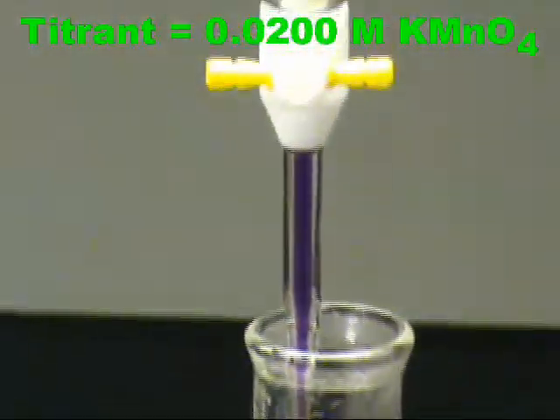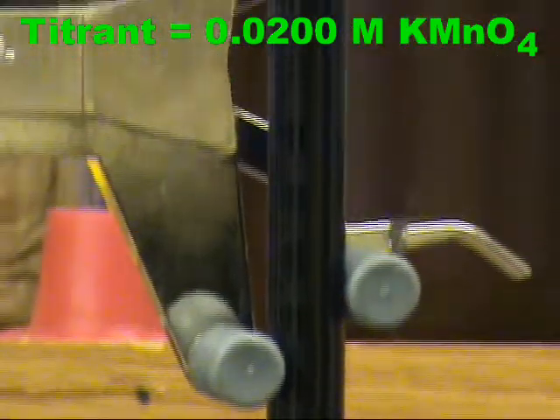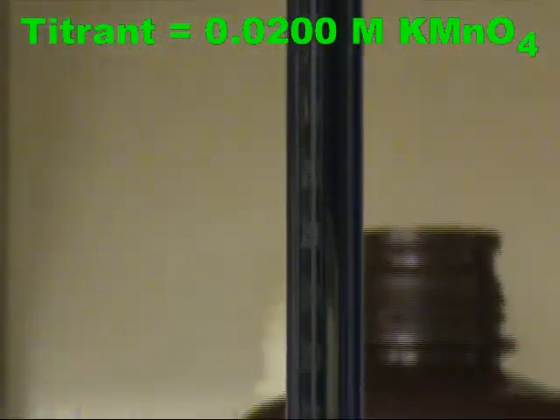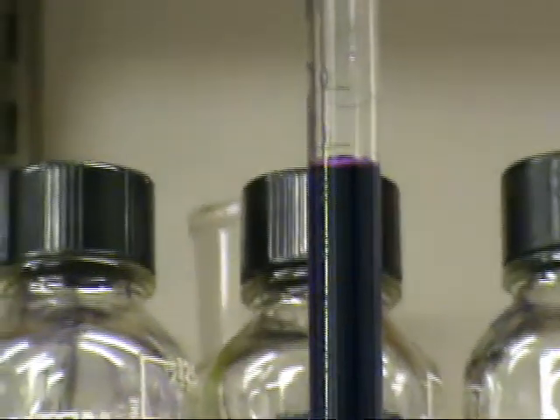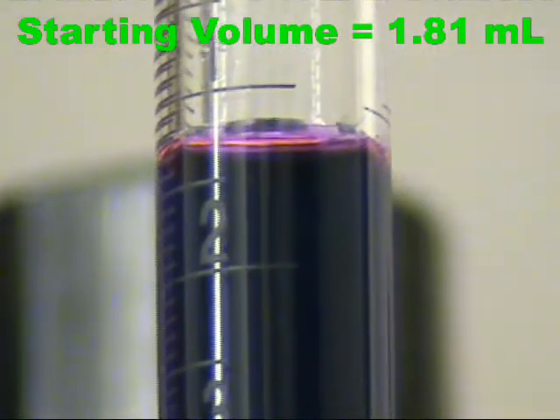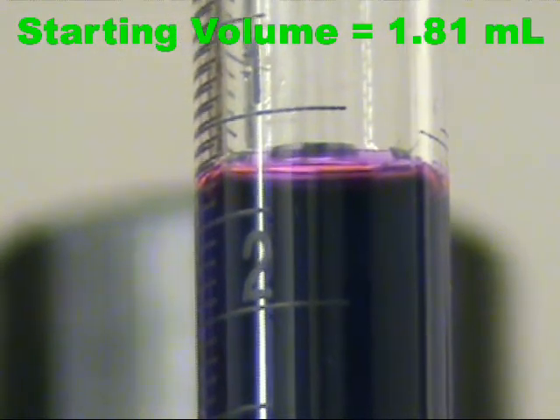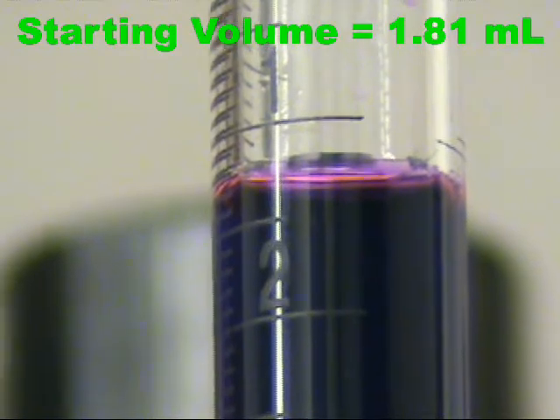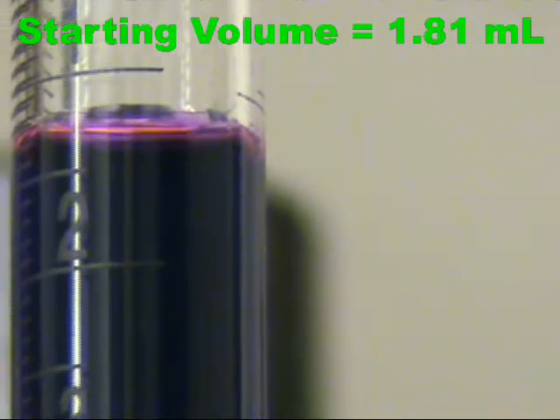The burette has been filled with 0.0200 molar potassium permanganate. Note the dark color of the solution, even at this low concentration. Be sure to record the starting volume of your burette. To properly read a burette, you read to the tenths and estimate to the hundredths. It is hard to tell from the camera angle, but the volume looks to be greater than 1.8 but less than 1.9. We'll call it 1.81.